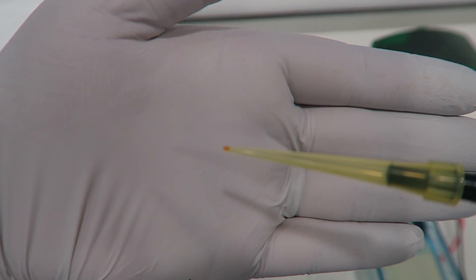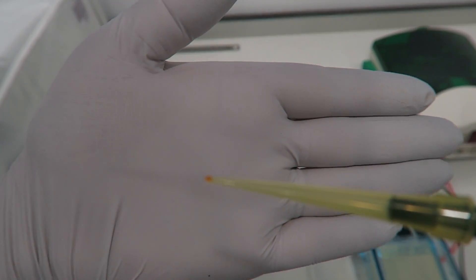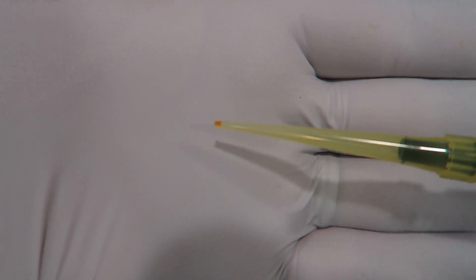You can then push through to the second stop to get all of the liquid out of the pipette tip. We can discard that tip now.